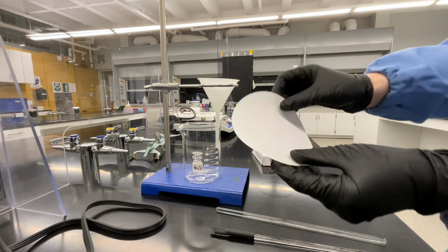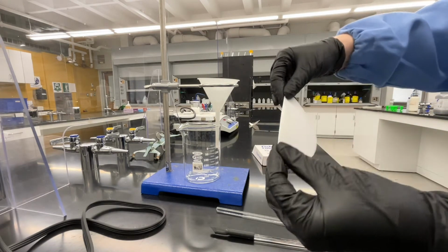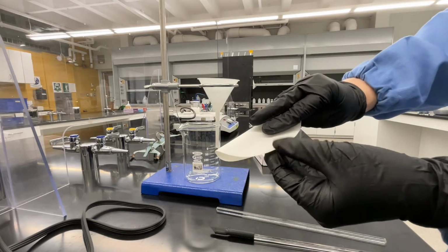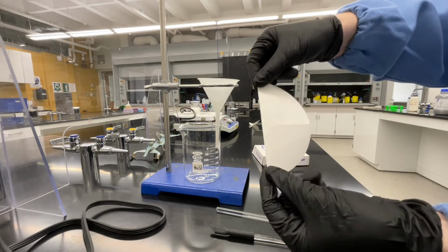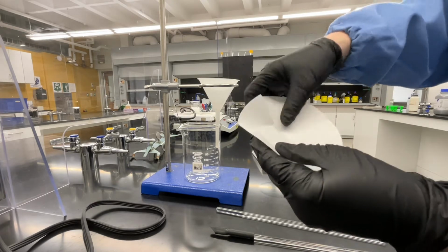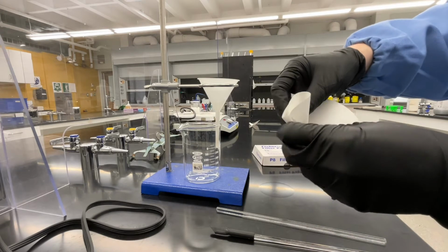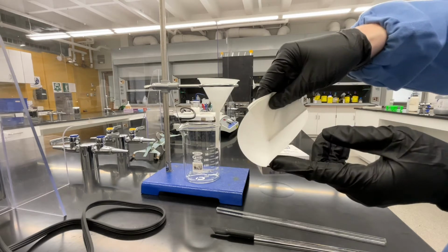Now, obtain a large piece of filter paper. Fold this in half, and then fold it in half in the opposite direction. This gives you a center point on the funnel. We need to make this funnel into a cone shape. To do this, you're going to tuck in one of the quadrants and fold it back so that it gets lined up until you have a nice cone shape. This is a little tricky, so you may need to play with your filter a little bit.